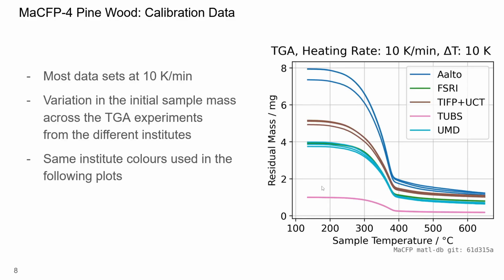Now let's have a look at some of the available TGA data in the MaCFP repository. I have chosen data for a heating rate of 10 Kelvin per minute, since most datasets available are for this heating rate. The main point is simply that the initial sample masses differ substantially between institutes. The data points below 120 degrees Celsius have been cut off because some datasets show an initial settling phase, presumably due to the release of moisture. The first points of each data series presented here are taken as initial mass for the following analysis.